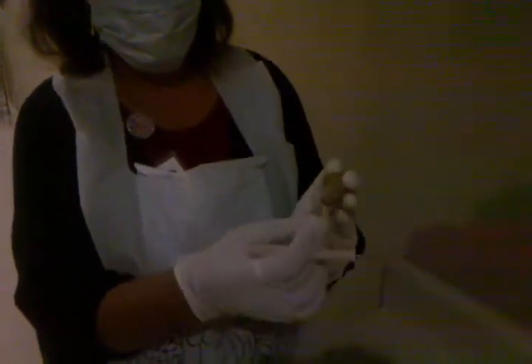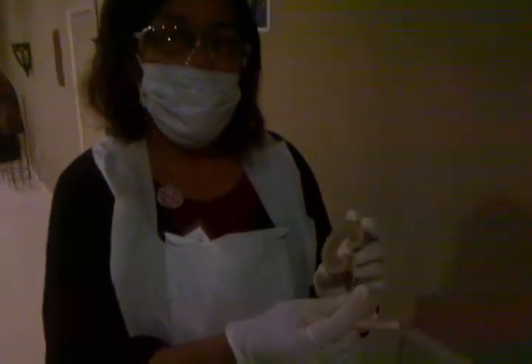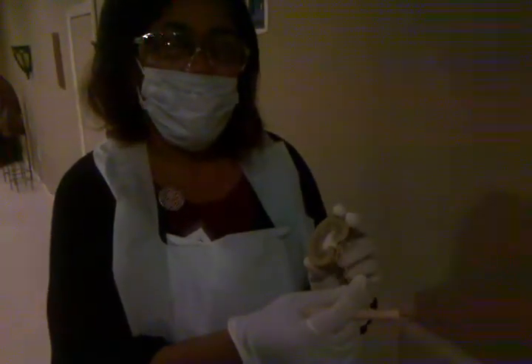And then we have here our renal artery. And then here, which is really hard to tell, we've got our renal vein in here. And this concludes my presentation of my dissection of my sheep kidney.